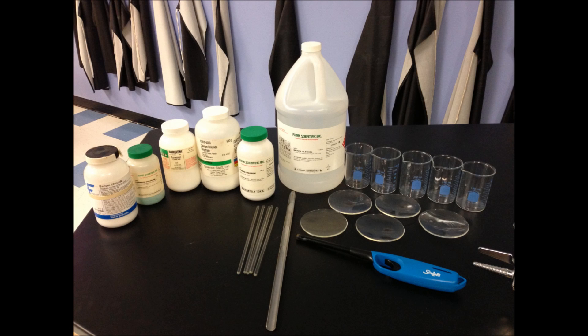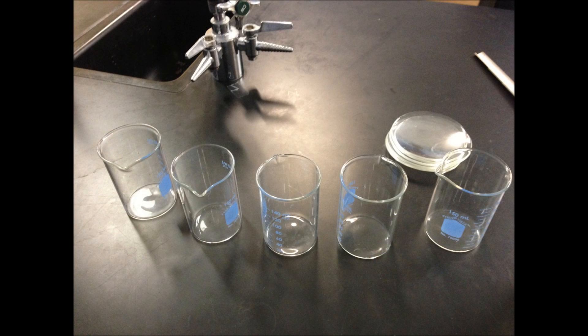The materials I need in order to conduct my experiment as shown in the picture are five stirring rods, five 150ml beakers, five scoops, five petri dishes, a lighter, methyl alcohol, barium chloride, copper chloride, potassium chloride, calcium chloride dihydrate, and lithium chloride.